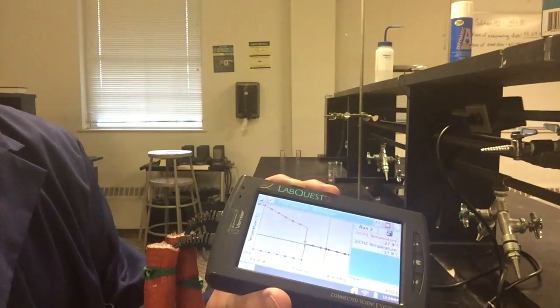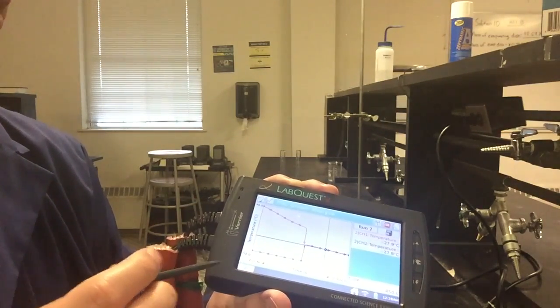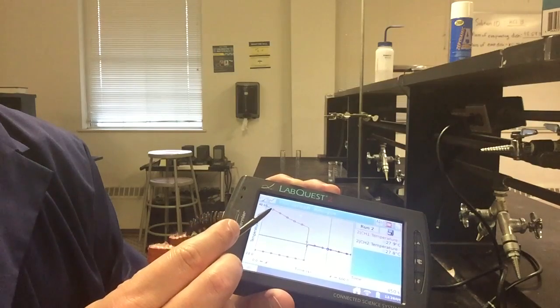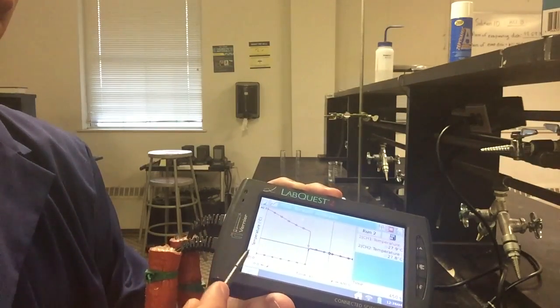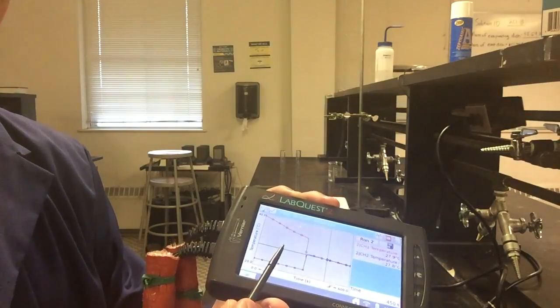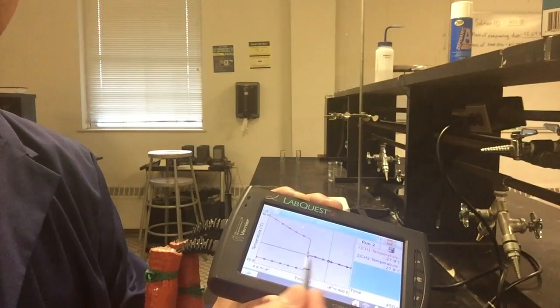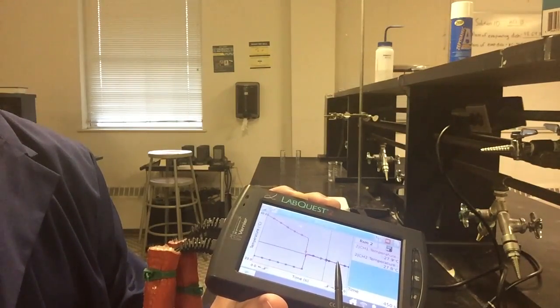All right, so we've finished the experiment. And what I just wanted to show you here is the LabQuest plot of what it's showing us. We have our hot water temperature being measured up here. That's going to slowly decrease until we mix things. Cold water temperature is pretty much constant. And as we mix things together, and apologize for the little bit of glare there, we see these two temperatures come together right here in the middle. And so that's good. So we expect to see that.